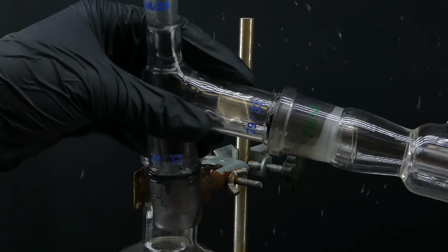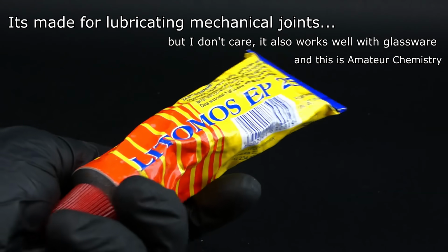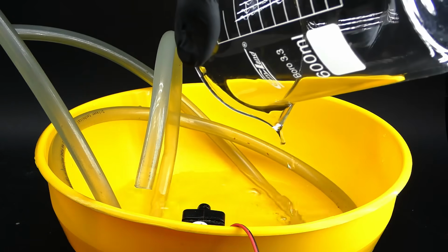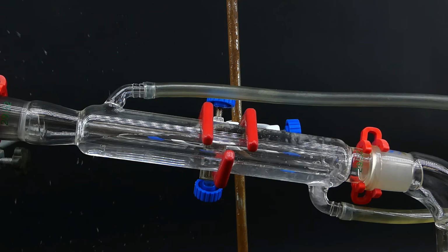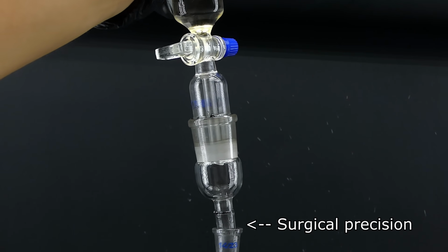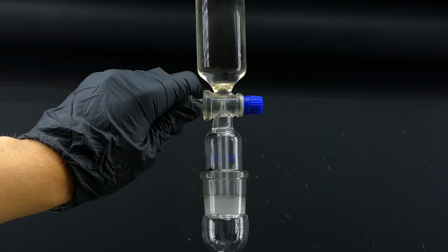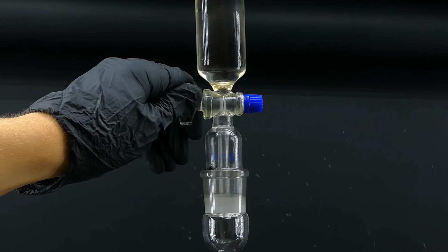I also greased all of the joints with this random grease that I found to prevent acetic acid vapors from escaping. To start the distillation, I filled up a bowl with cooling water and turned on the water flow to the condenser, filled the dripping funnel with the whole 150 ml of sulfuric acid, and connected it to the apparatus. I then lightly opened the valve, which allowed the sulfuric acid to slowly drip into the sodium acetate in the boiling flask.